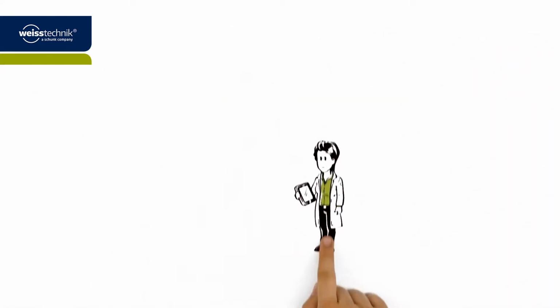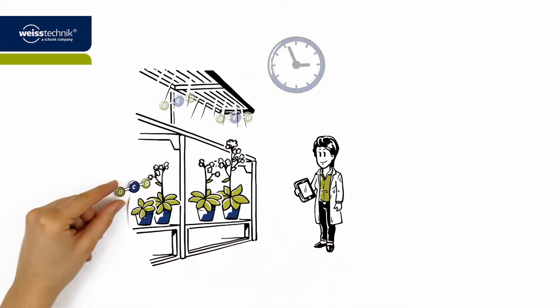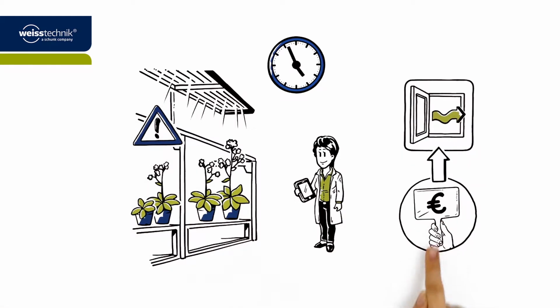Dr. Wagner does some research and finds out that in a closed growth room, the available CO2 can be used up by the plants within less than 2 hours. After this, they virtually stop growing. When writing her call for tenders, she therefore requires bidders to offer 4 changes of fresh air per hour, as is provided as standard by products such as those from weisstechnik.